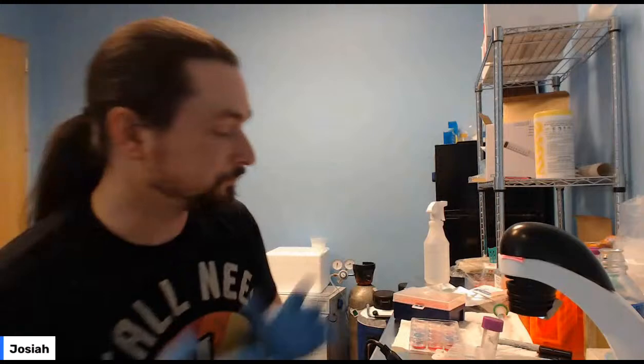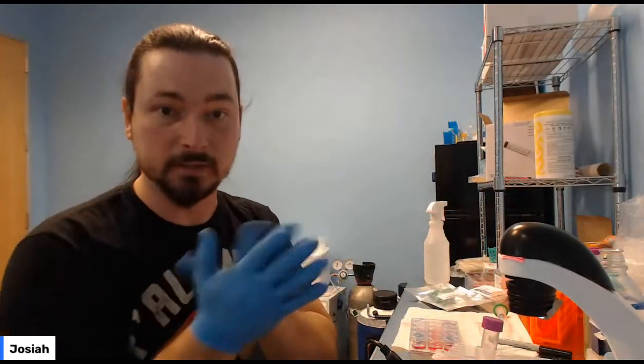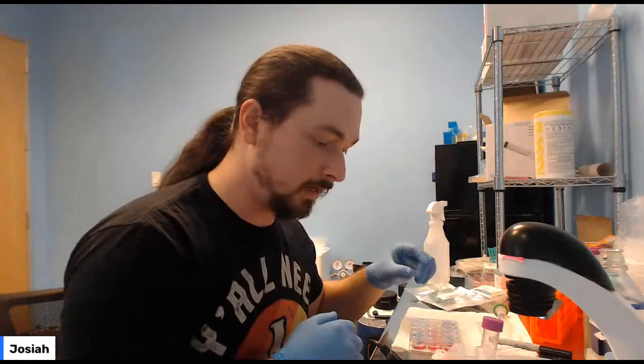They just sit there with X-gal floating around and nothing happens. The ones that do have the LAC-Z gene have this extra enzyme, and it starts to break down that X-gal, and as a result, it turns things blue. That's how you can see which cells have been modified and which have not been modified.